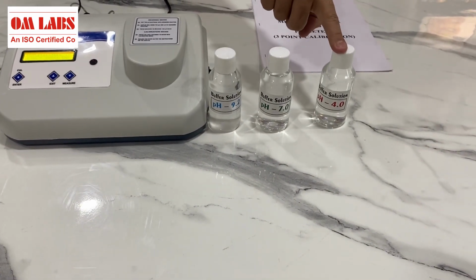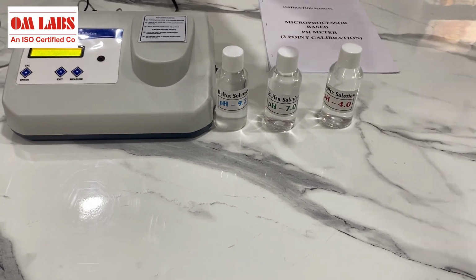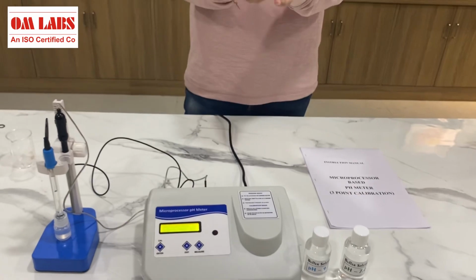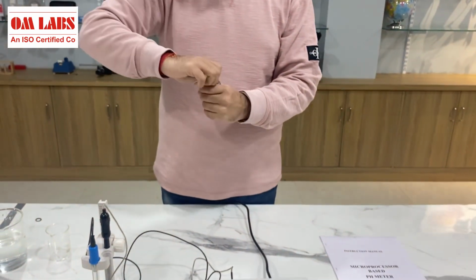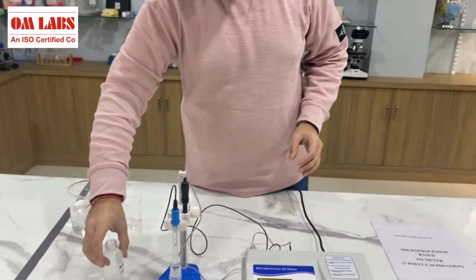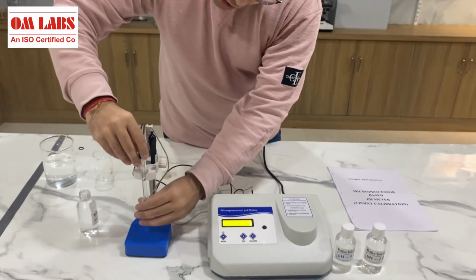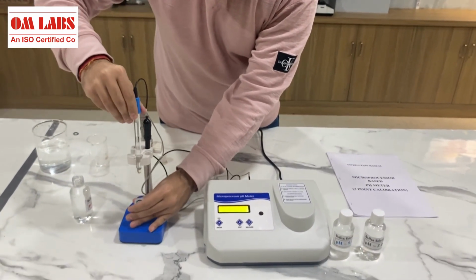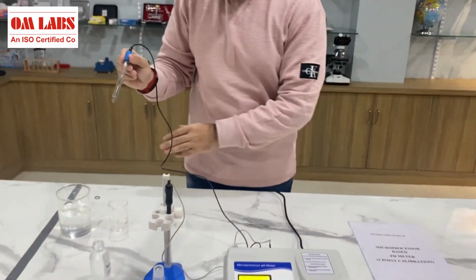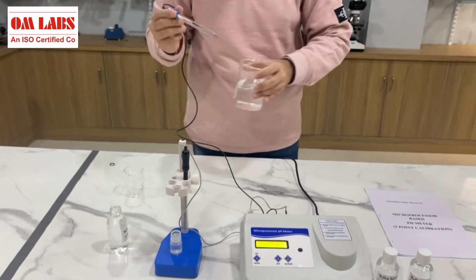The first one is pH 4, the second one is pH 7 and the third one is pH 9.2. Now what we have to do is we have to simply take this and open the bottle, and by taking our probe, we have to handle the probe very carefully because it is a glass probe, and we should not touch it by bare hands ideally.